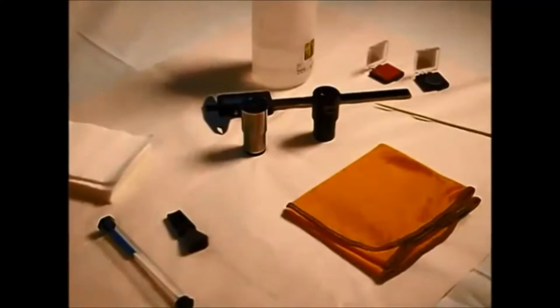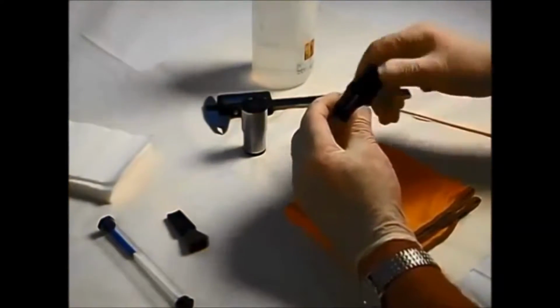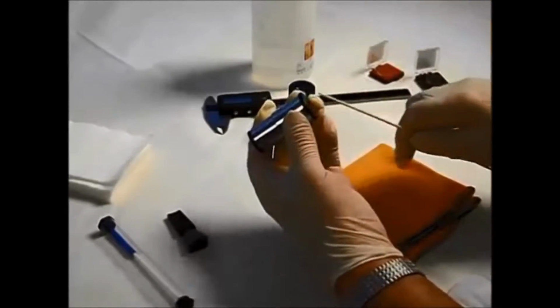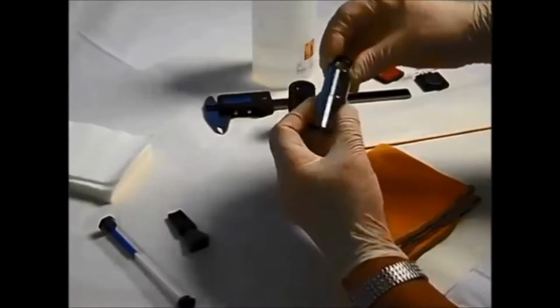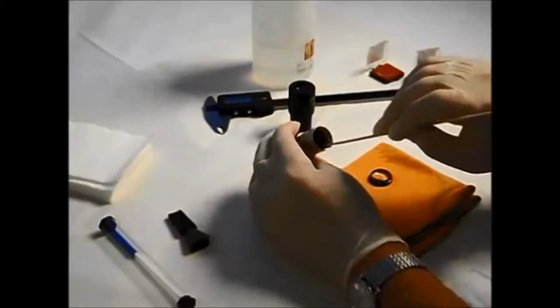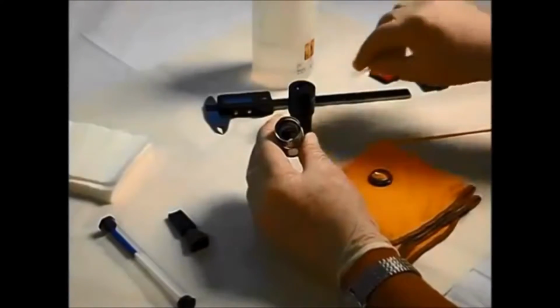Okay, measuring the size of a reticule. Now there are two types here. This one is a Huygenian eyepiece. You can see that there's a lens here and here. So this is the eyepiece lens, the field lens is on this end, and in fact it does unscrew. And the position for the reticule is actually just inside here. There's a shelf just inside this eyepiece, and that's the position where we're going to fit the reticule.